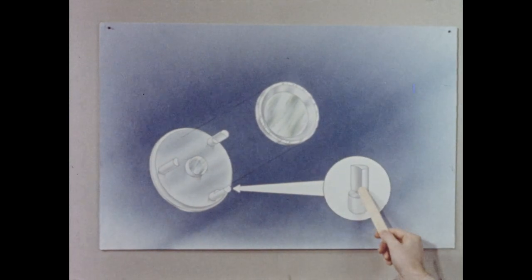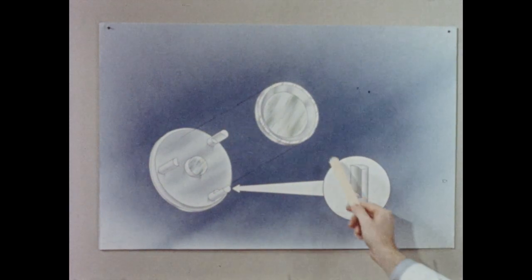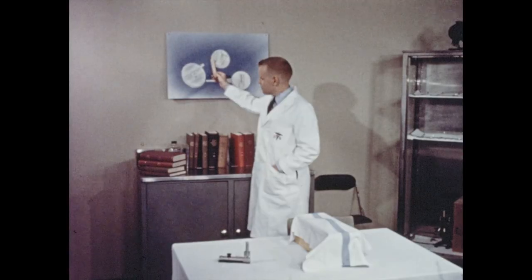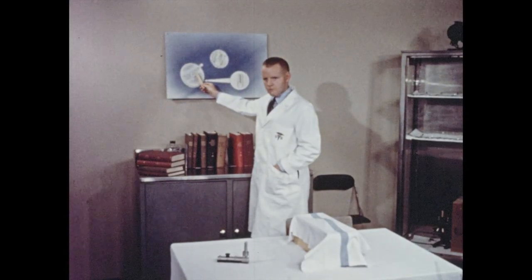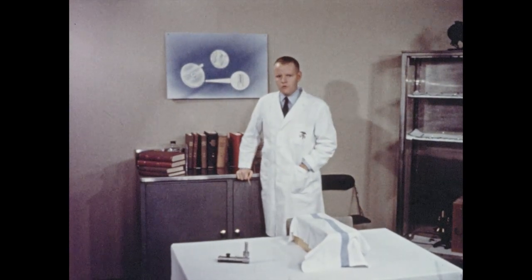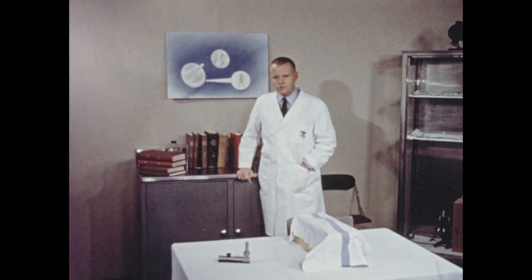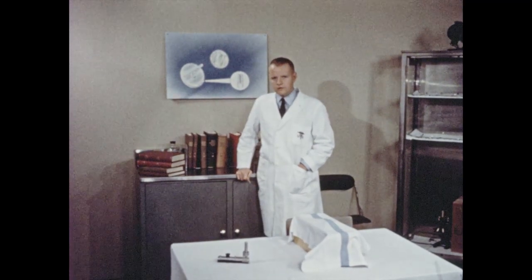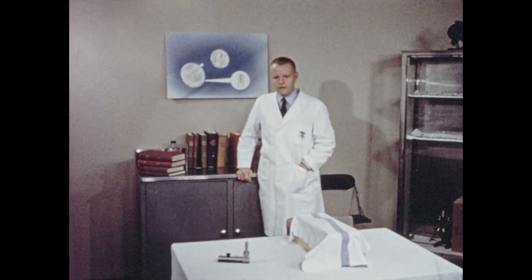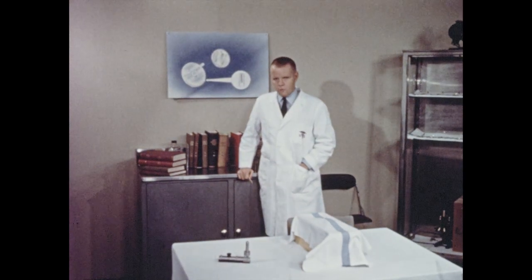Notice the recess, for it is important that when the chamber is assembled, the clearance between the under-surface of the glass cover slip and the top surface of the central observation platform be between 20 and 25 micra. If this clearance is less than 20 micra, vascularization will be inadequate, and if the clearance is greater than 25 micra, the tissue preparation will be too thick for high magnification microscopy.